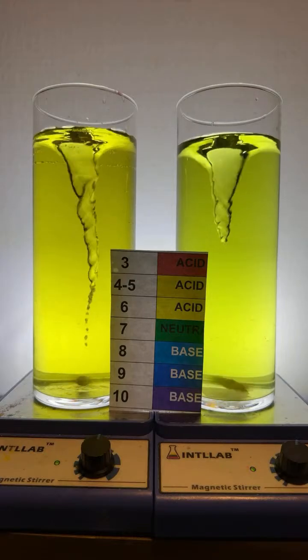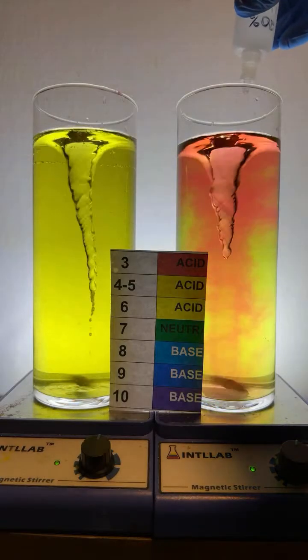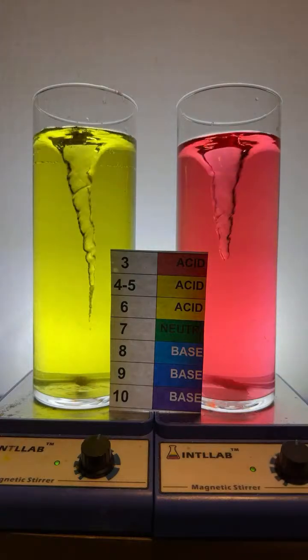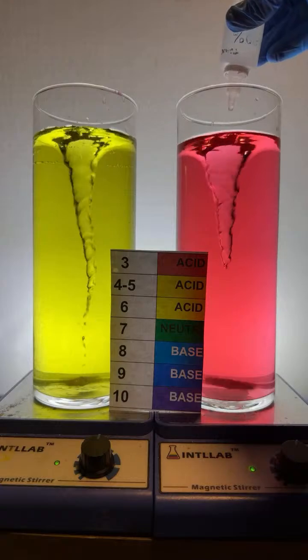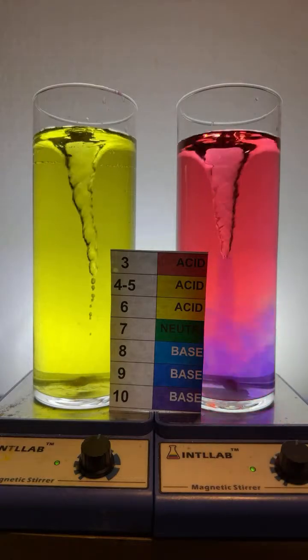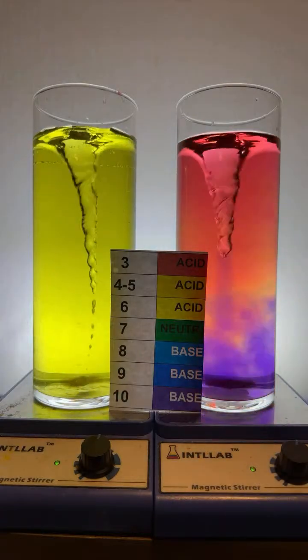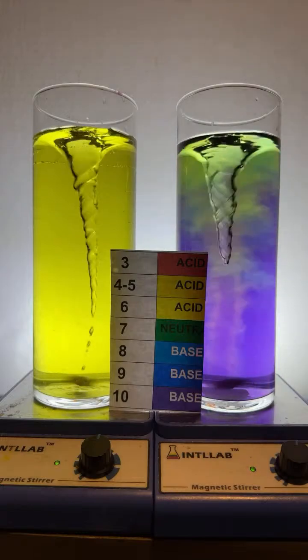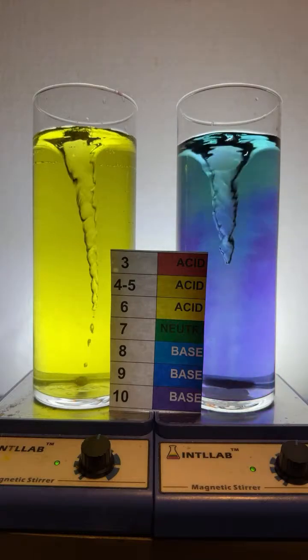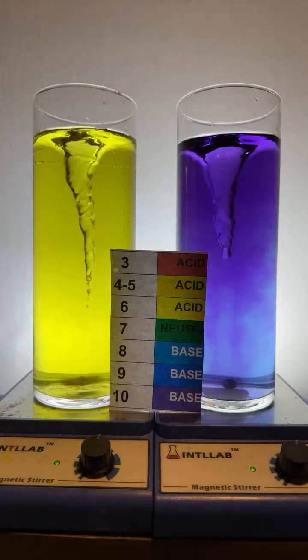I appreciate that. All right, let's start adding a bunch of acid over here on the right. Very cool. And I'm going to add a drop of base over here on the right. In goes 1 drop. And we got a flash of rainbow, baby. Come on, I love that. All right, 1 more drop. That should get us back to pH 10.